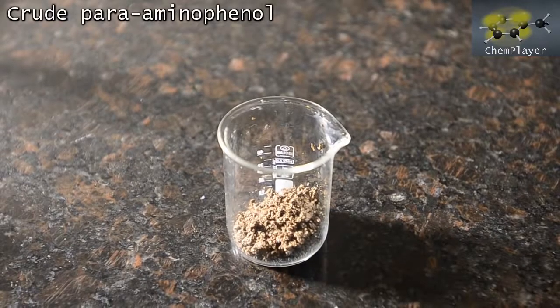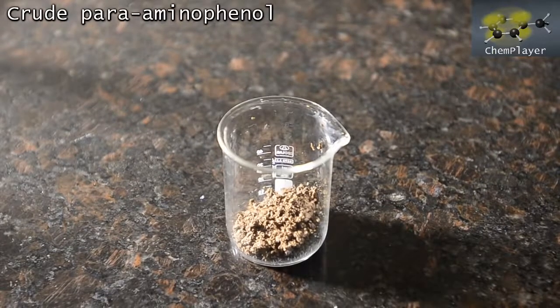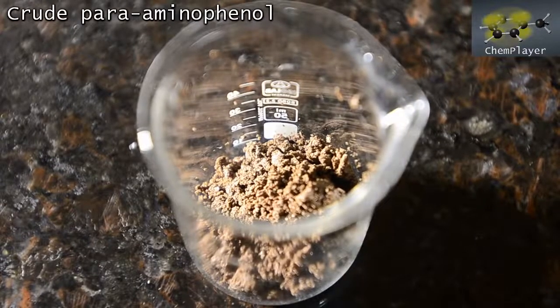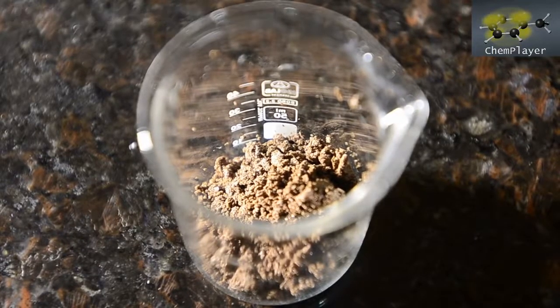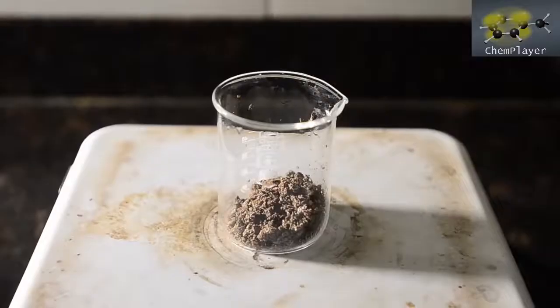We didn't bother to weigh it as it is still quite a brown color. The pure compound should be white, so this obviously has impurities and decomposition products in it. The easiest way we can think of to purify is simply to recrystallize this from warm water, so let's give it a go. We've got a crude product in a beaker on a hot plate.